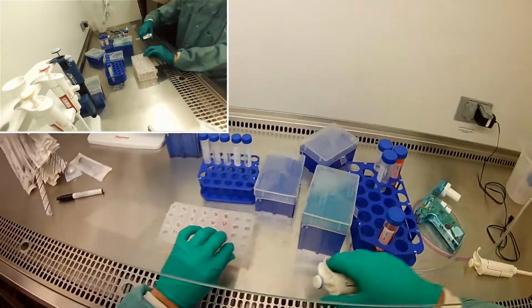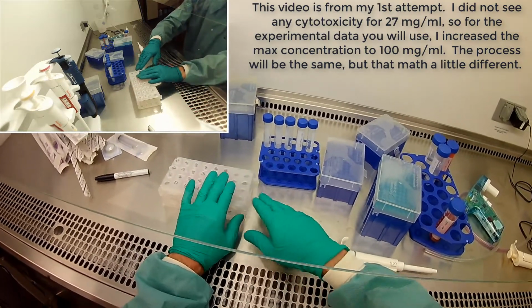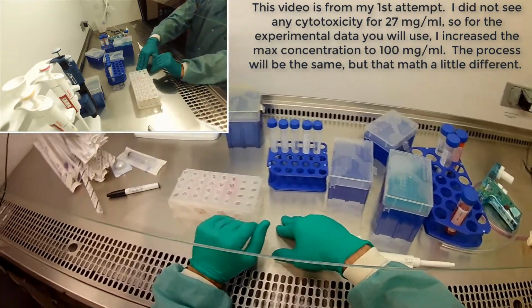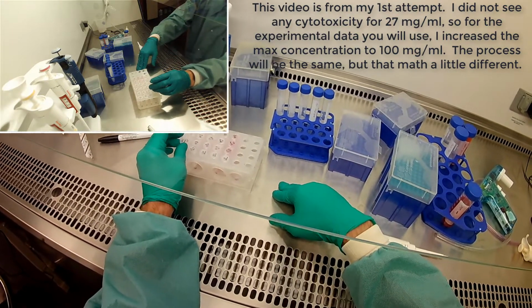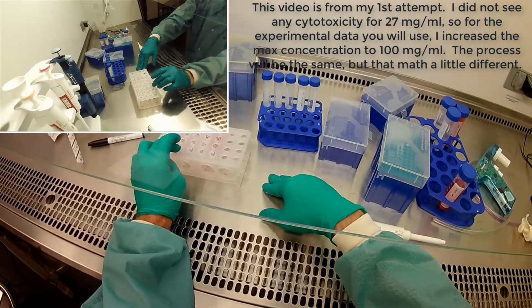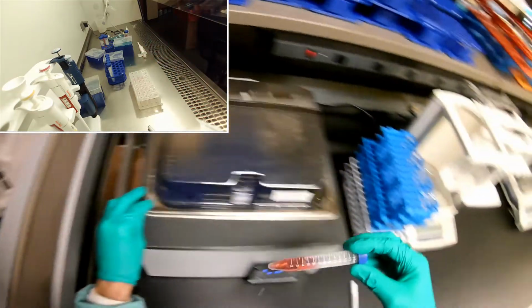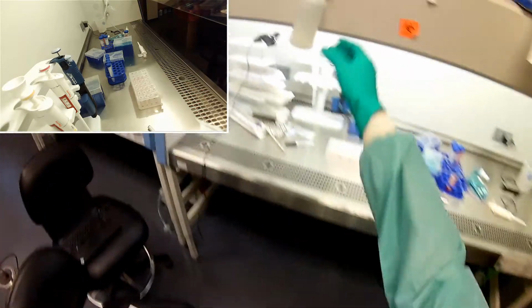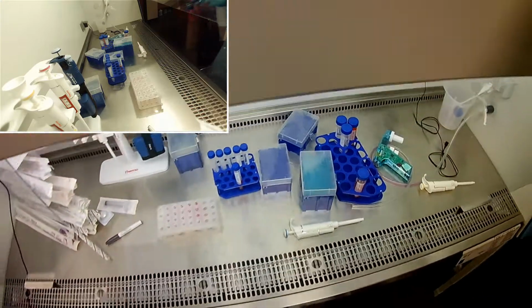The last one to do is the sugar, okay? And so we're making more of the sugar because in order to do the math, right, we need at least 1 ml of each. So I made 5 mils right now of 27, but we're going to take 4 mils of that to make the 22. And so we need 1 ml left over for that. So again, we just put that in the water bath so the sugar would dissolve a little bit better.